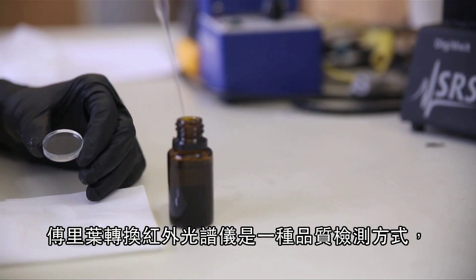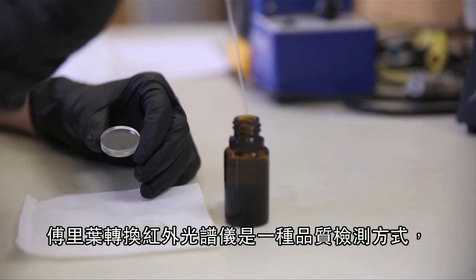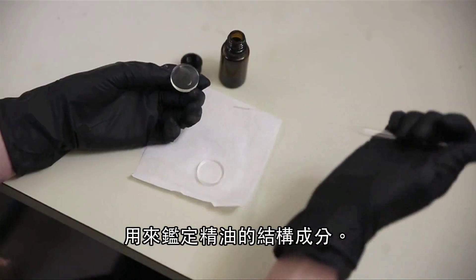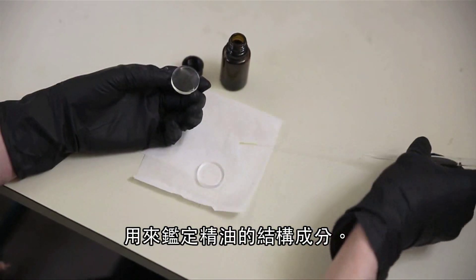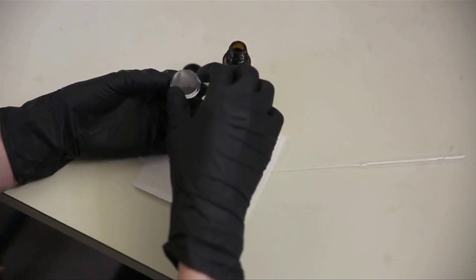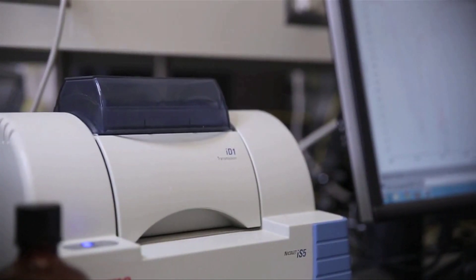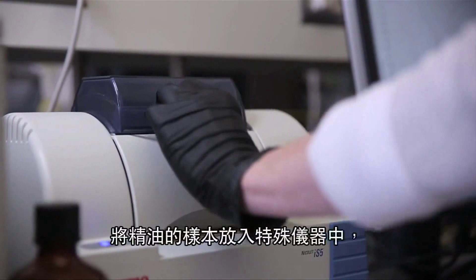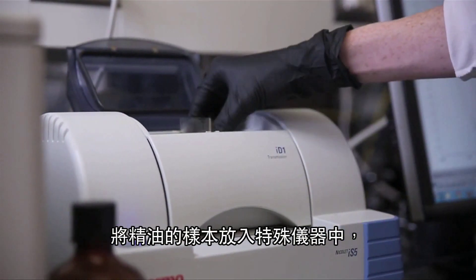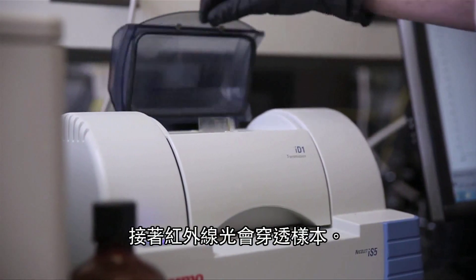FTIR is a quality control test used to identify the structural components that make up the constituents within an essential oil. A sample of essential oil is placed inside a specialized machine and an infrared light is passed through the sample.